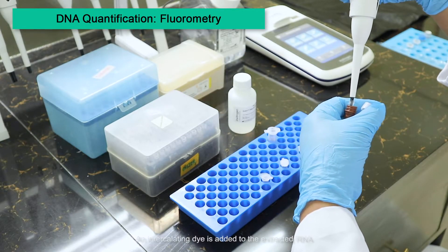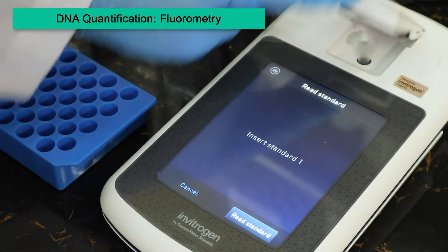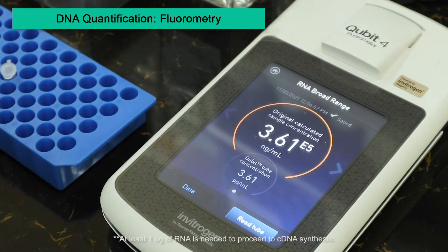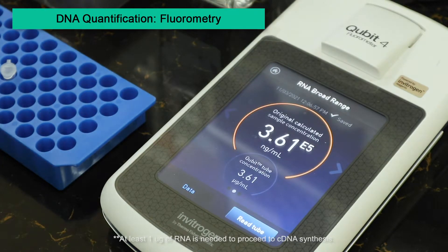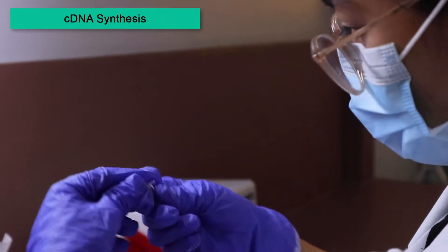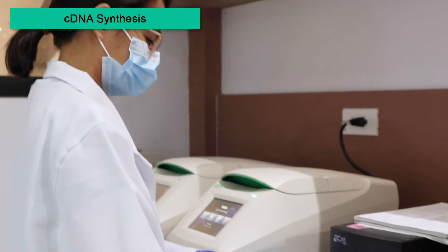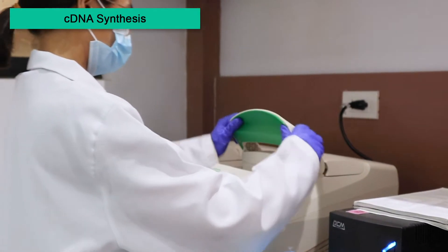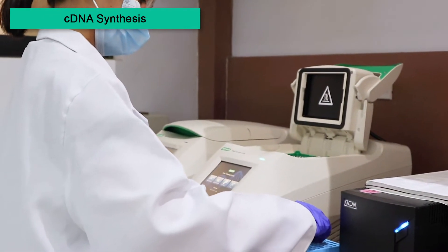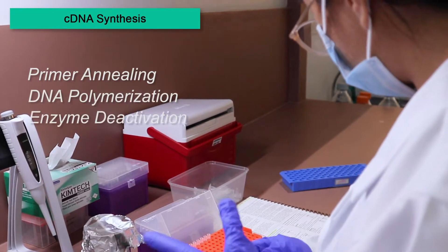An intercalating dye is added to the extracted RNA and read in a fluorometer. Based on a set of standards, the concentration of RNA is then determined. Once the purified RNA has passed the quality, purity, and quantity check, it can then be reverse transcribed into complementary DNA. The reverse transcription reactions involve three steps: primer annealing, DNA polymerization, and enzyme deactivation.